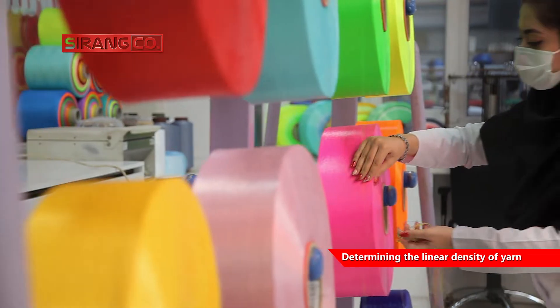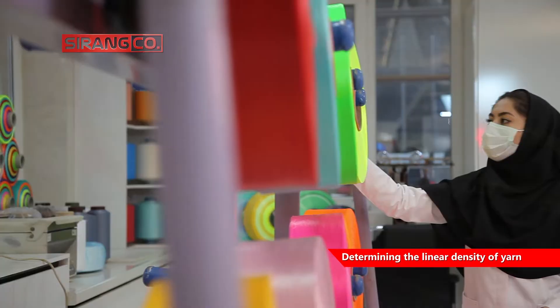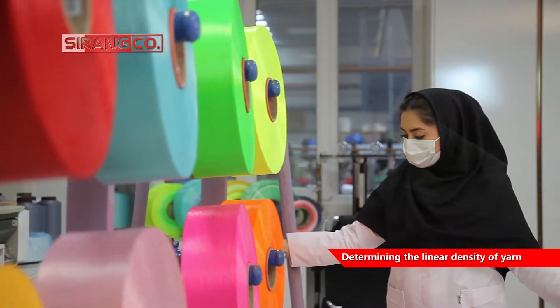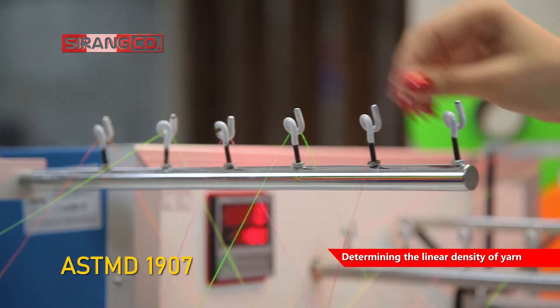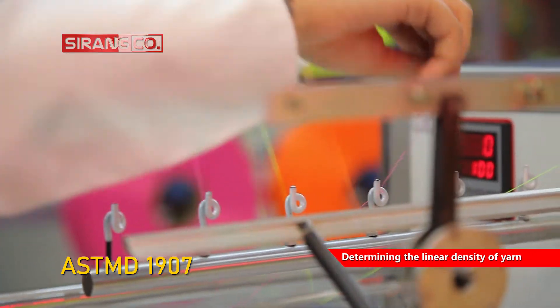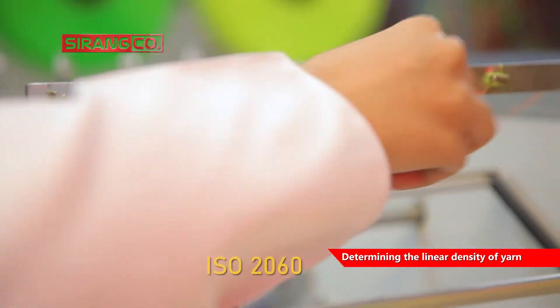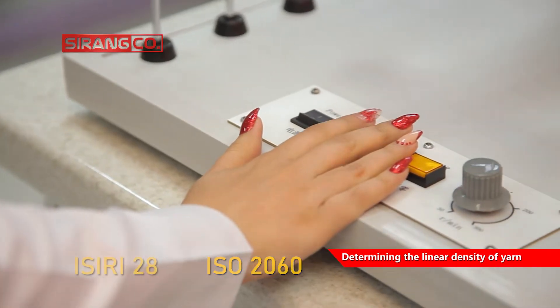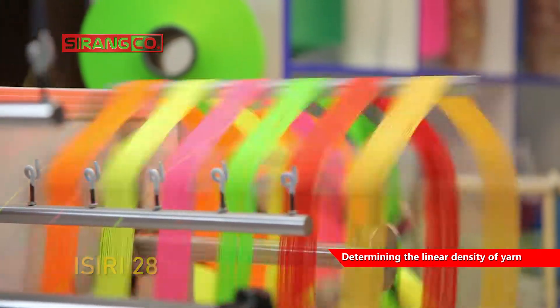The existing practical standards in determining the linear density of yarn in the form of skein are the International Standard ASTM D1907, ISO 2060, and the National Standard of Iran No. 28.